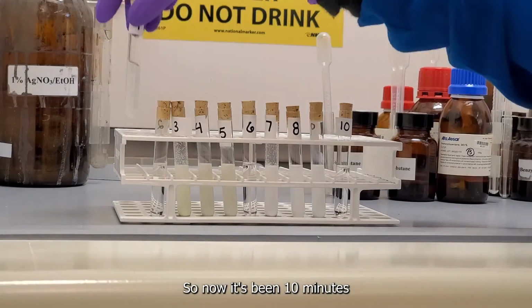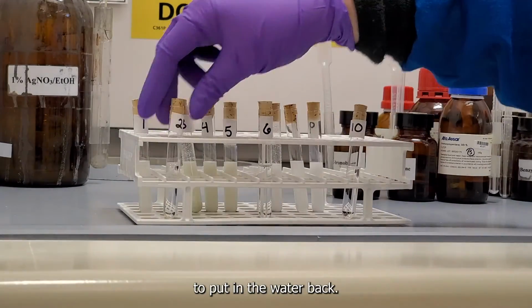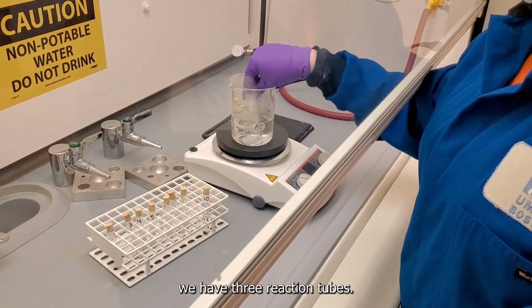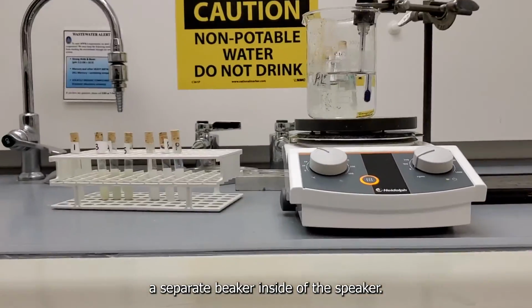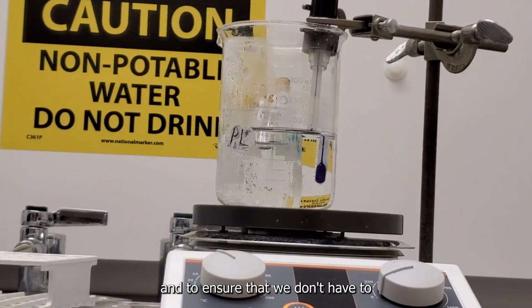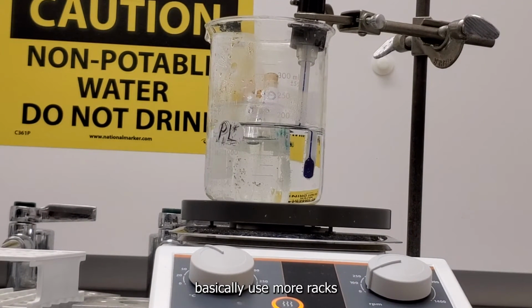So now it's been 10 minutes, and we're separating what has been precipitated versus what we're going to put in the water bath. As you can see, we have 3 reaction tubes, and notice that we've added a separate beaker inside of this beaker. This is to help keep our sample standing and to ensure that we don't have to use more racks to hold the test tubes up.